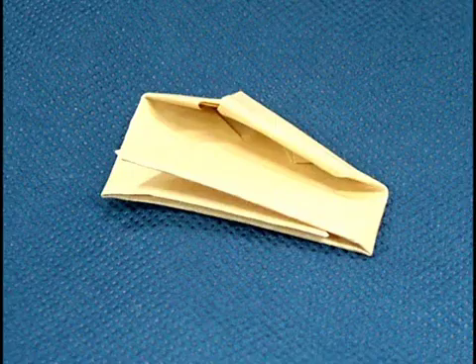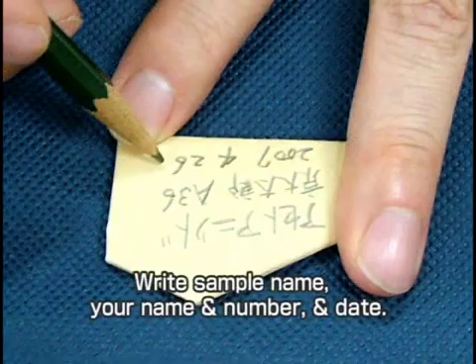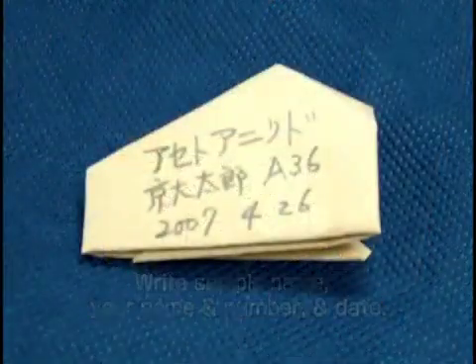Confirm the sample to be held neatly in the paper. Write the sample name, your name and number, and the date on the reverse.